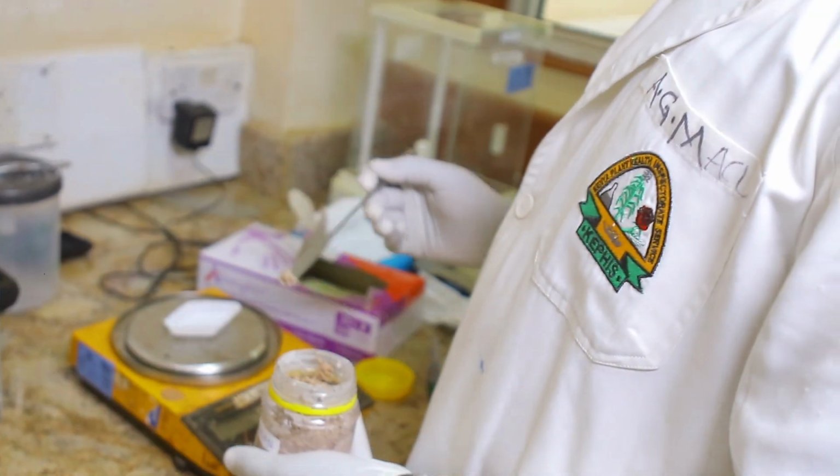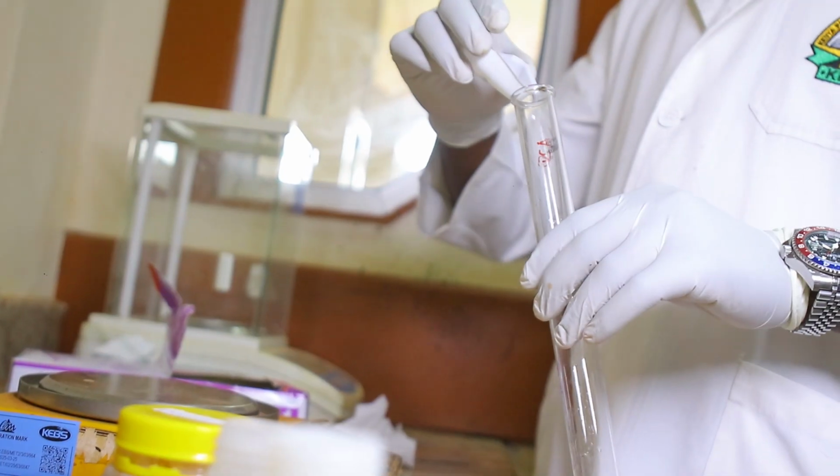My name is Dr. Alex Njoge, and this is the KEPHIS Heavy Metal Labs, where we do, as the name suggests, analysis of heavy metals in a wide range of sample matrices. So we have soil, fertilizer, water. Water could be for irrigation, for drinking purposes. And we also do environmental monitoring, including things like fish, soil, and sediments.